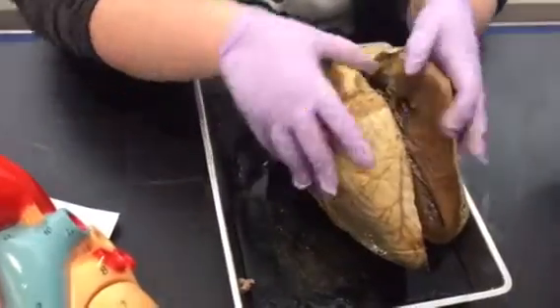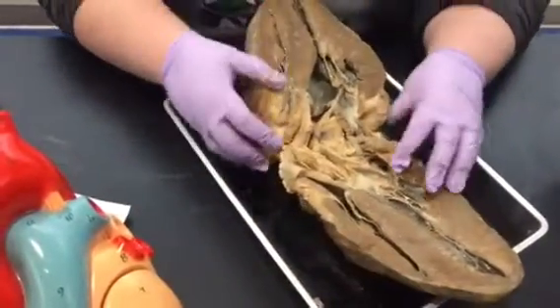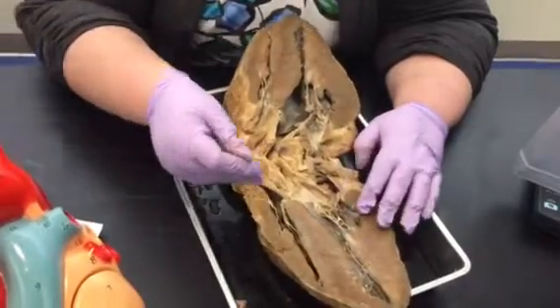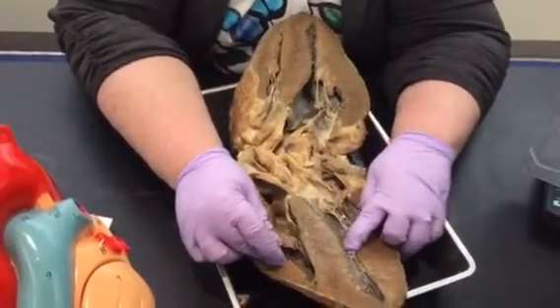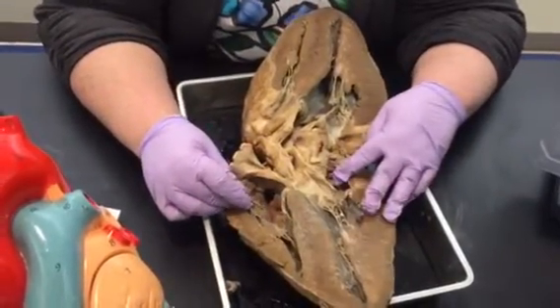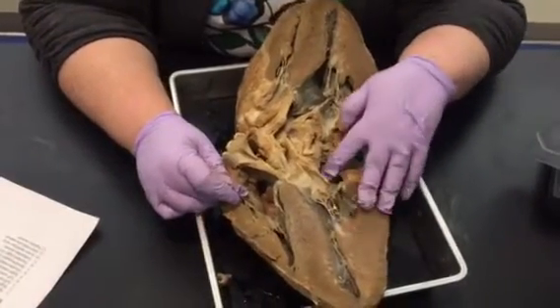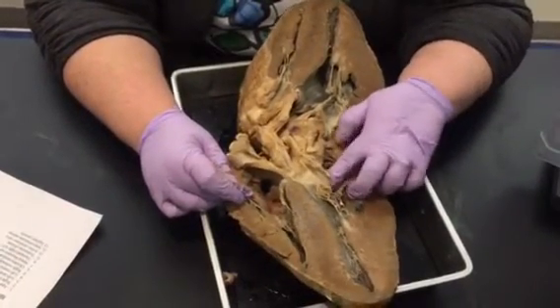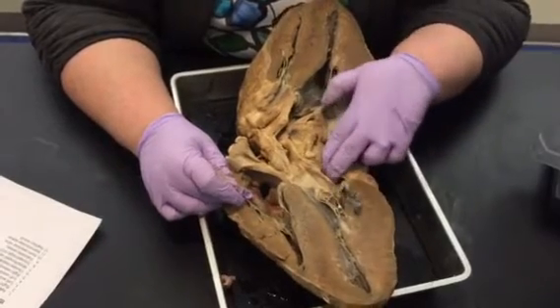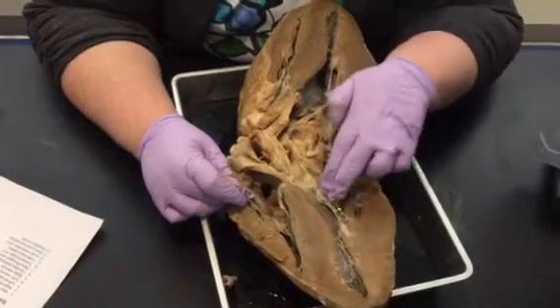Popping it open: we have the right ventricle, left ventricle, right atrium, left atrium. The way you tell the difference between the ventricle and the atrium is this valve — everything above the valve is the atrium, everything below the valve is the ventricle. Above the valve: atrium. Below: ventricle.